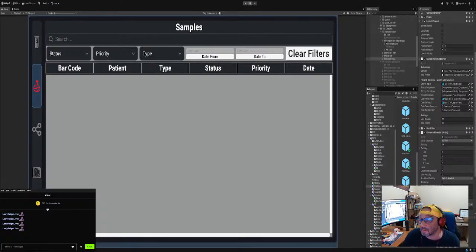My name is Bronx Mike, and we're building out a Supabase LIMS system, which is a Lab Information Management System. This is for gathering samples, doing tests on samples, getting sample types, inventory, all that other good cool stuff.